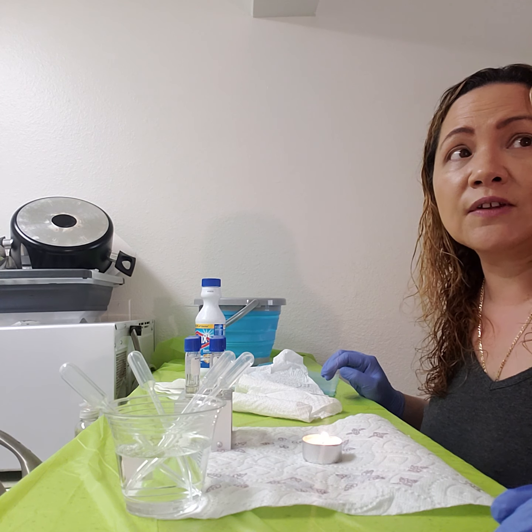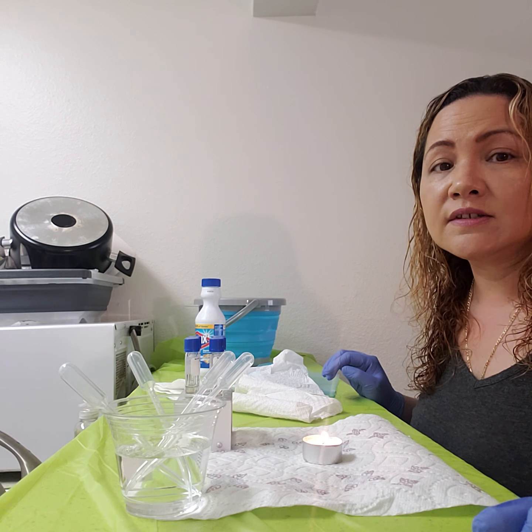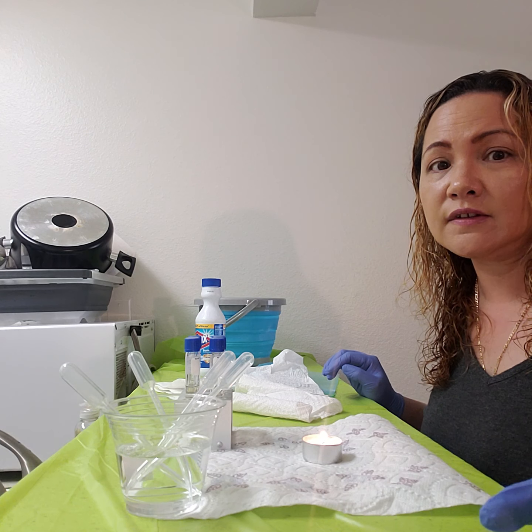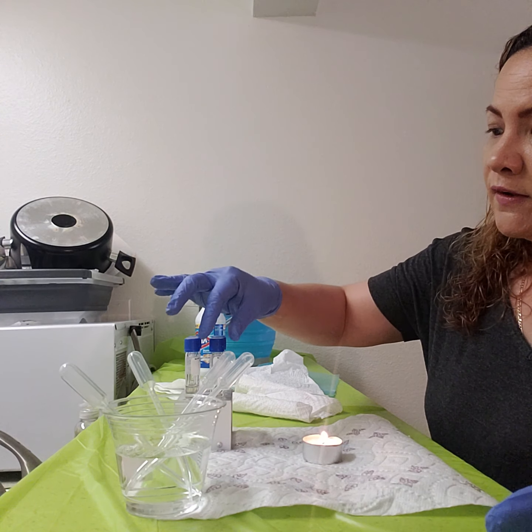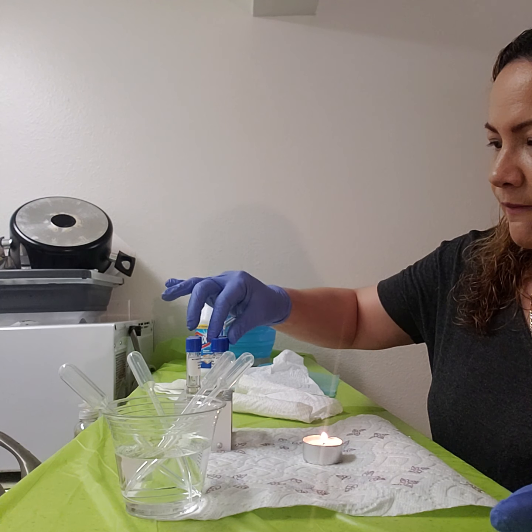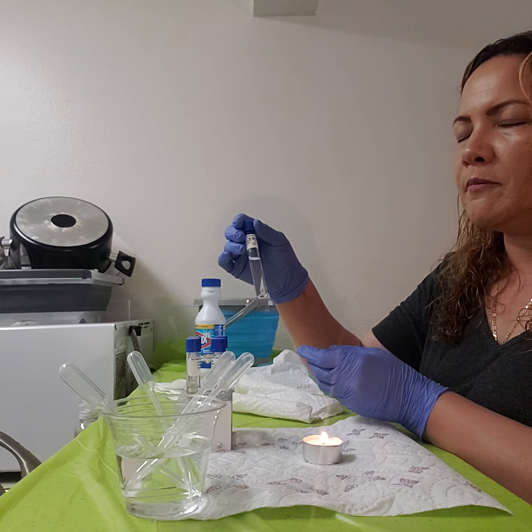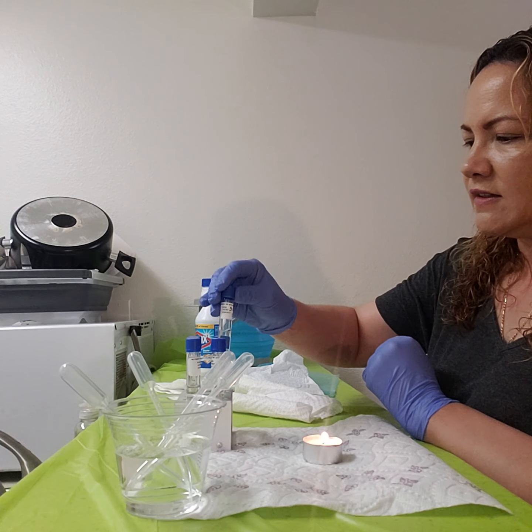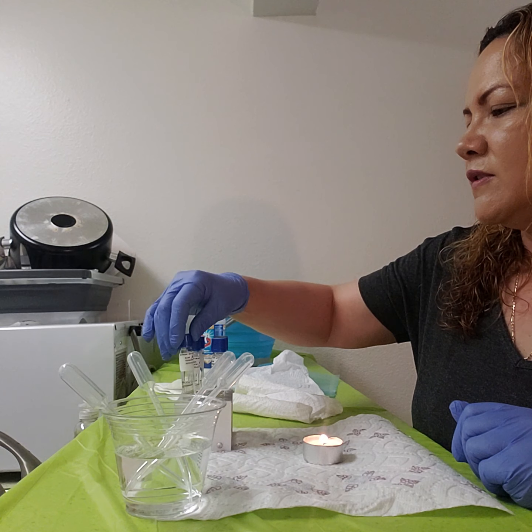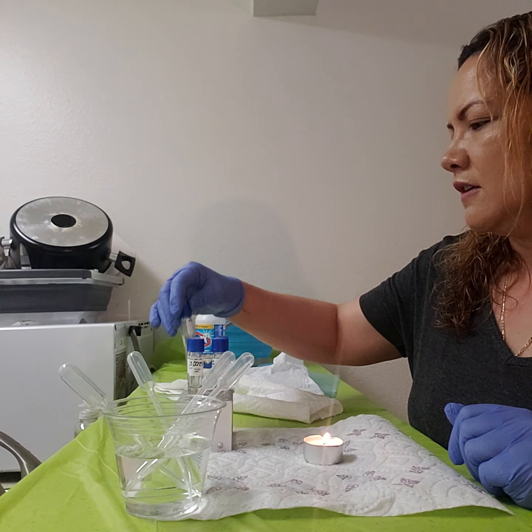I'm going to be talking about the environmental influences on microbial growth and the salt tolerance testing. Okay, but first, the exercise we're doing today is on the tolerance. We're going to be using the nutrient broth with 1% NaCl for the S. epidermidis, sorry, and 7%, and then the 15%, along with 1% S. cerevisiae and 7% and 15%.